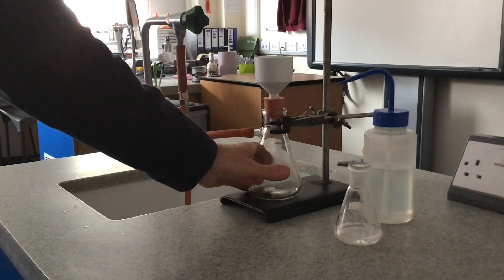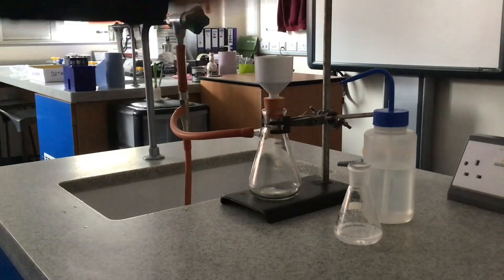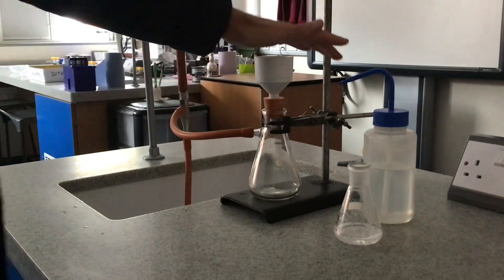If I put my hand over here it'll stick to the funnel. Let's just show you that.